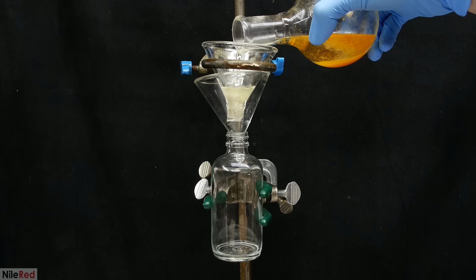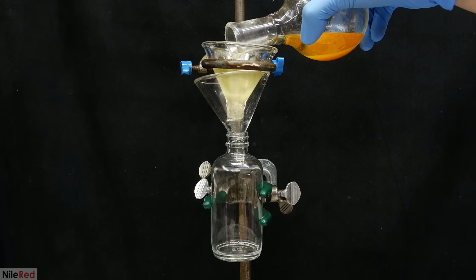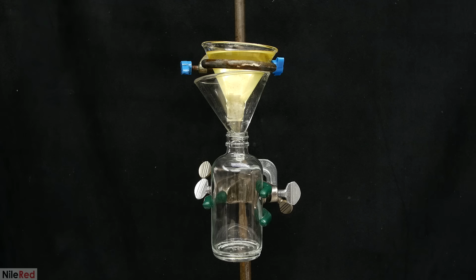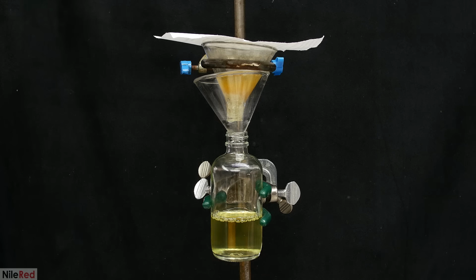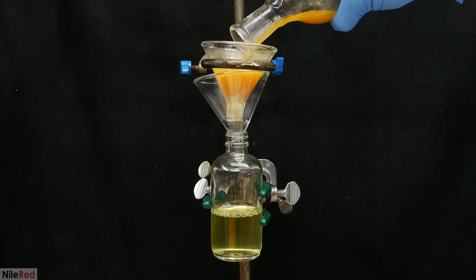Anyway, the cyclohexane solution is added to the funnel, and it slowly starts to filter through. At this point, we can see that the solution itself is yellow, and the orange color is coming from the solid stuff. I added as much as I could without including the solids to try to get it to filter through as fast as possible. Once almost everything had filtered through, I poured in the last bit that remained.